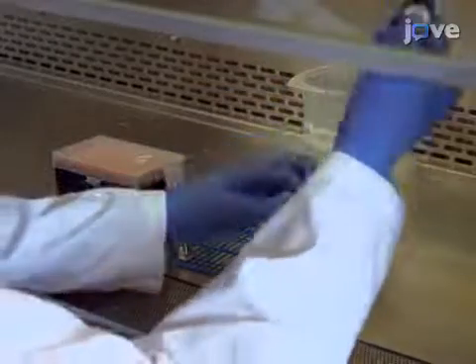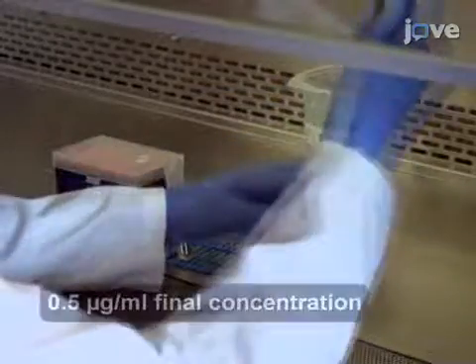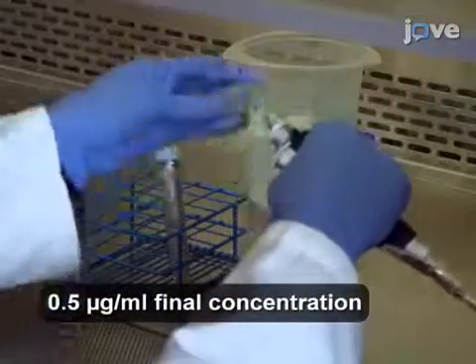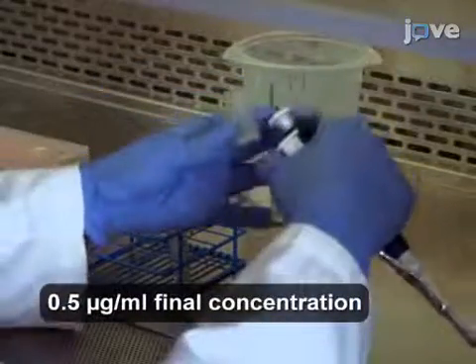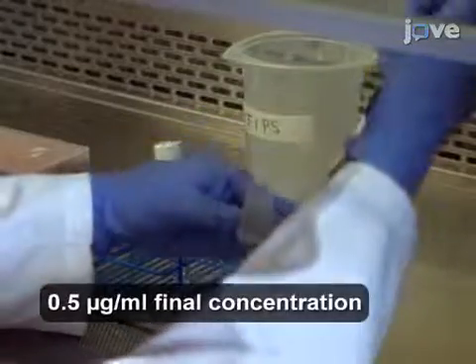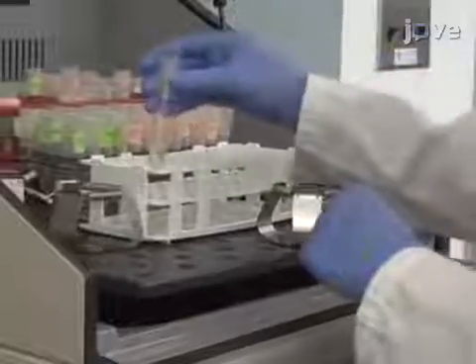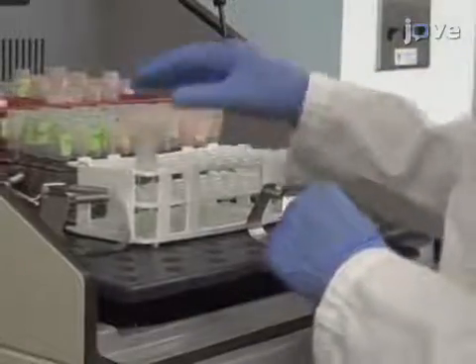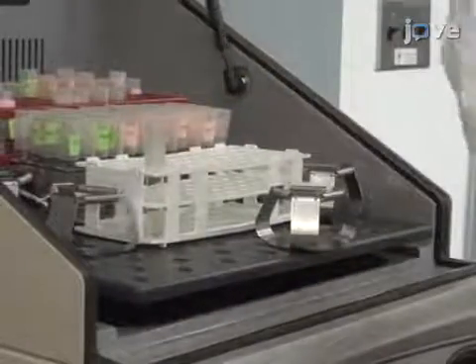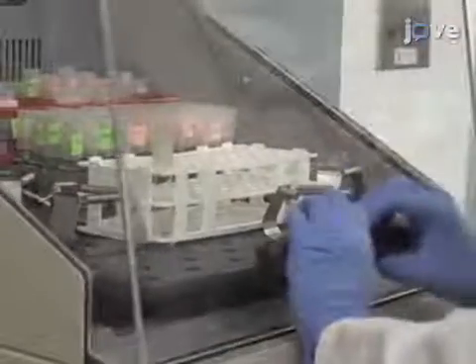Ensure that the culture has a noticeable increase in turbidity, and then add mitomycin C. Next, incubate the culture overnight with shaking at room temperature.